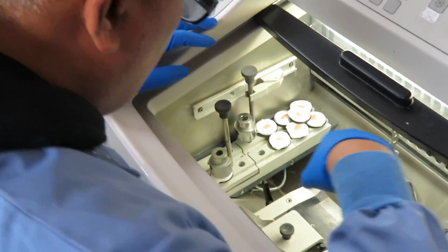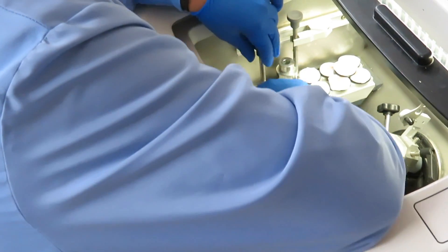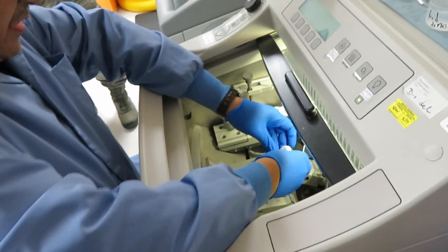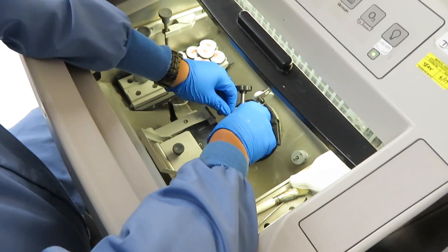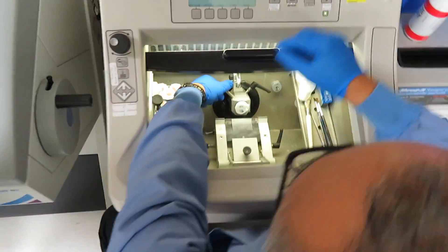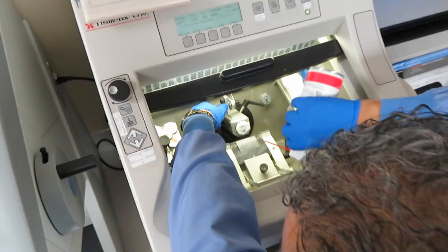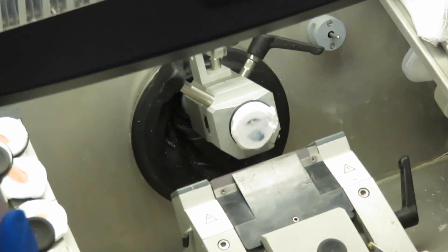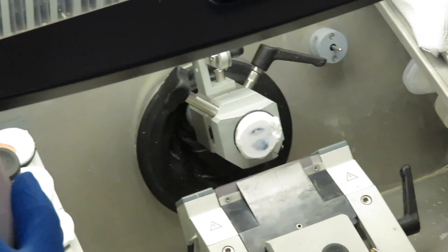Yeah, to flatten it — we don't want to redo it with the freeze spray. Nice and flat, in order for us to put it on the cutting station. That's fast freezing. All that construction noise — this is like practicing pathology in a war zone.